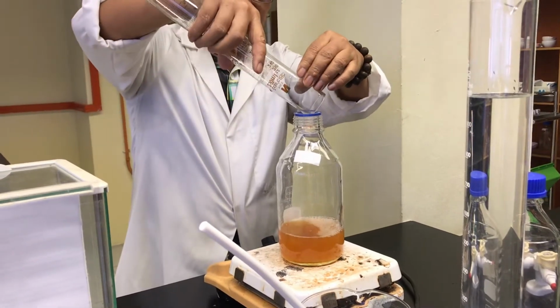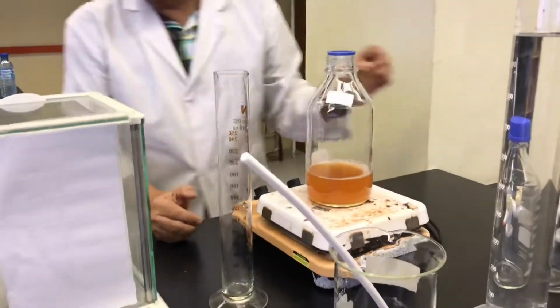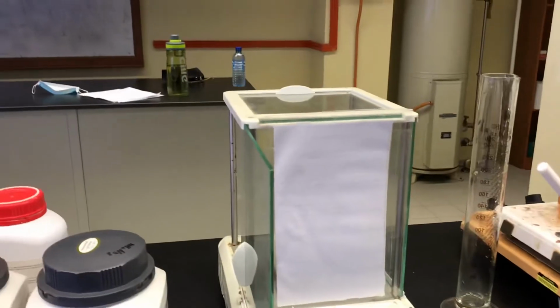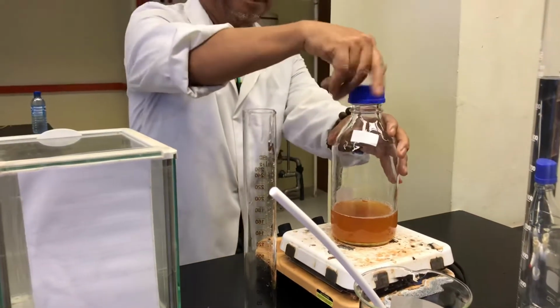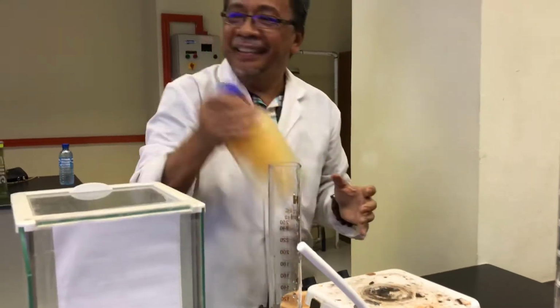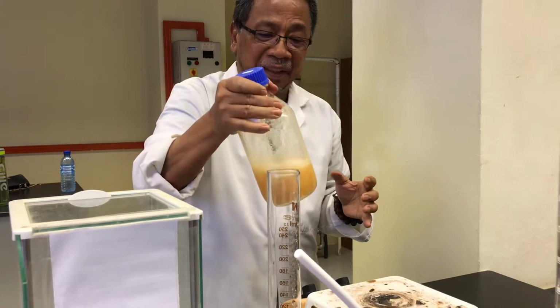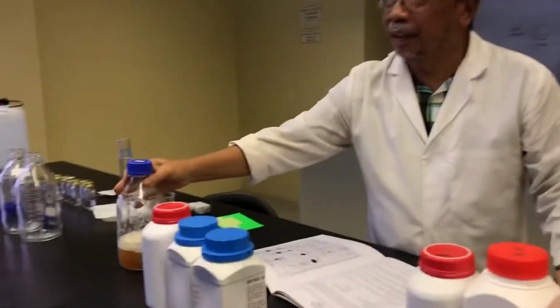Okay, you pour everything. You don't have to stir it, all this thing. You just, where's the cap? Put the cap on, and then we just shake it. Okay, you just shake it. We just leave it like that. I will show you. Put it into the basket.